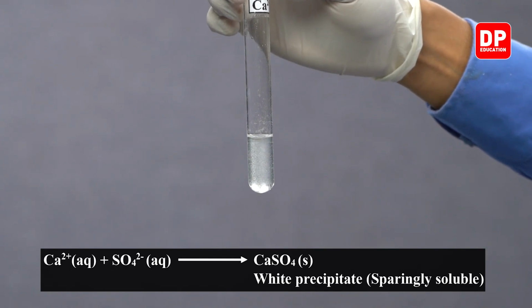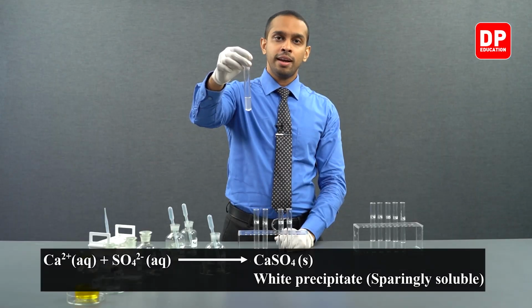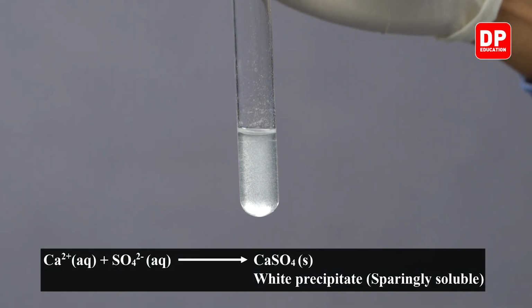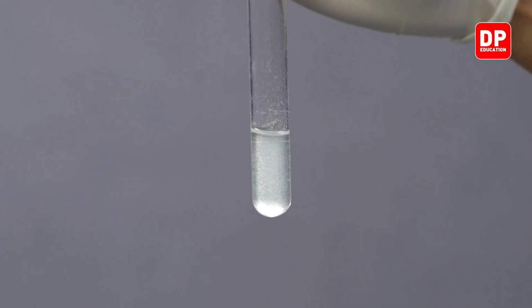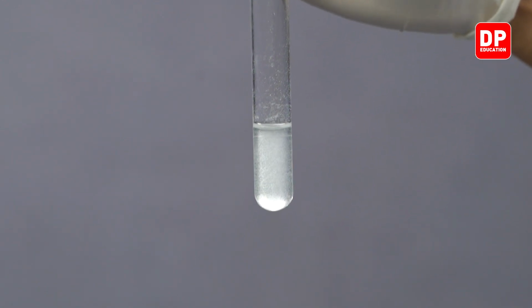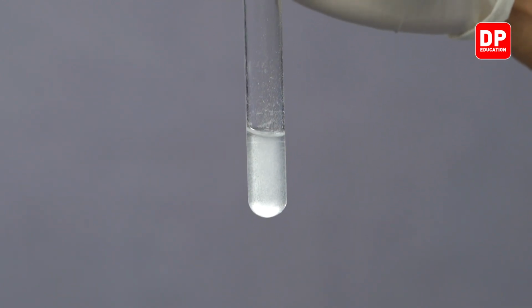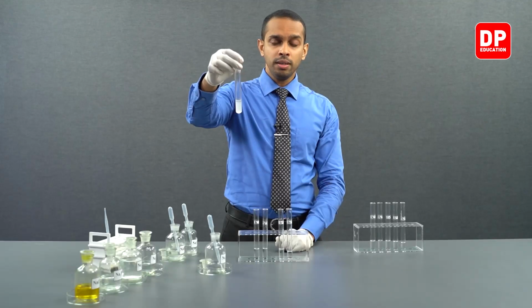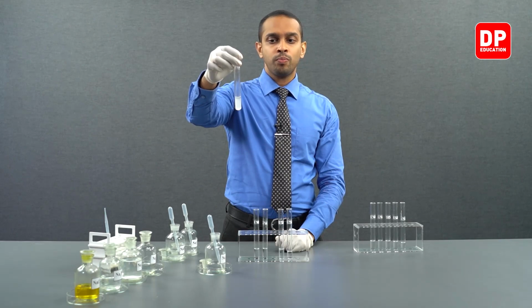You can see very slowly forming a white color precipitate. Calcium sulfate is a sparingly soluble white color precipitate. It is not completely insoluble in water. However, the precipitate that you form is slightly or sparingly soluble in water.